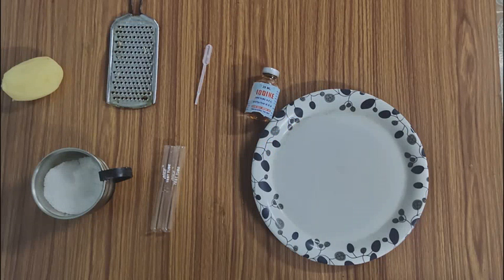Here we require a peeled potato, a grater, a dropper and iodine solution, a plate, two test tubes and some amount of salt.